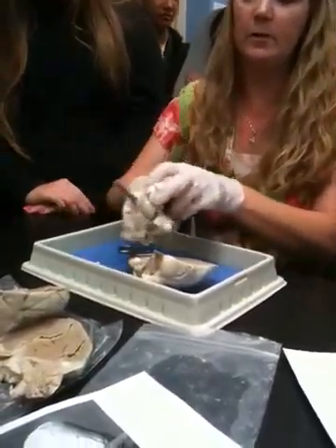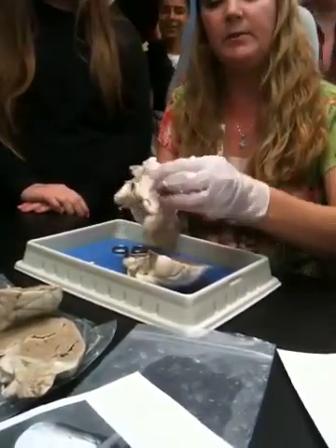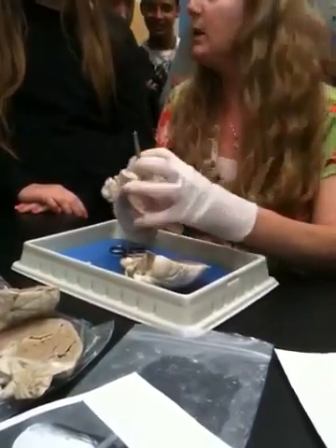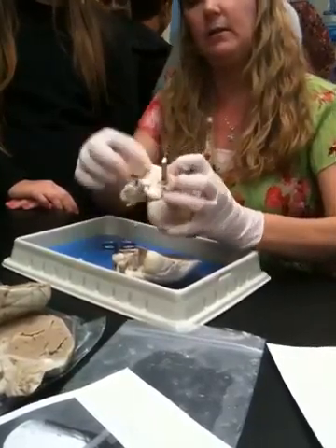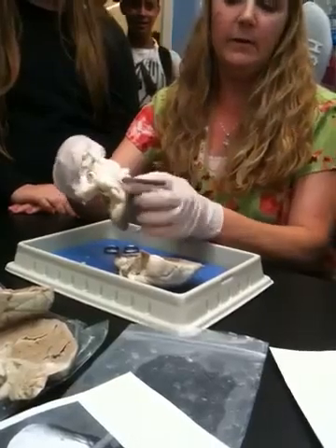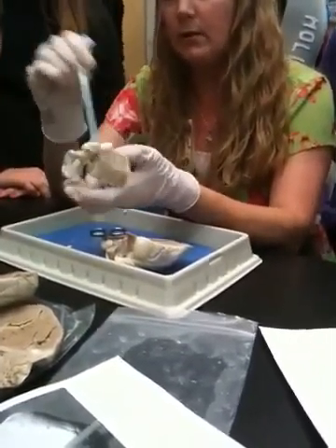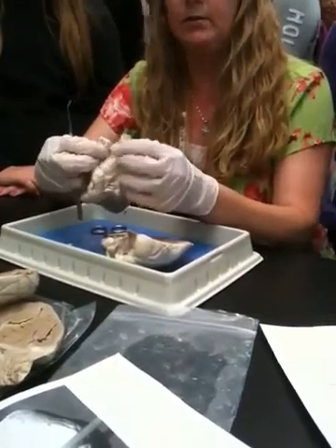It comes out this. Do you see the opening though? Yeah. A lot of you guys didn't have this on there. That was all cut off, right? So it was really hard to see. You didn't actually have that vessel right there. What is that again? The inferior vena cava right here. Okay, so it's like right in the middle almost. Yeah, and so you didn't see that.